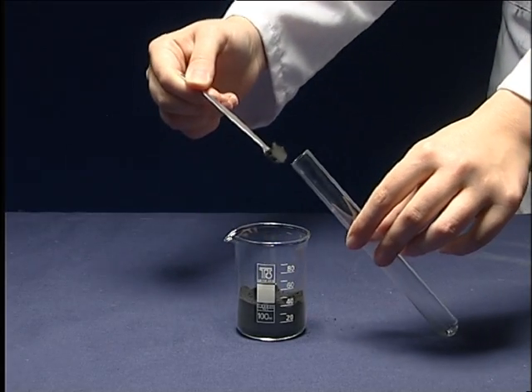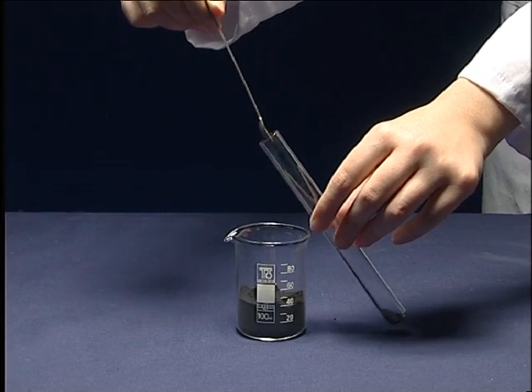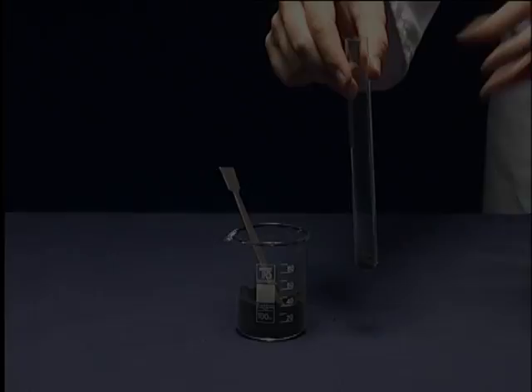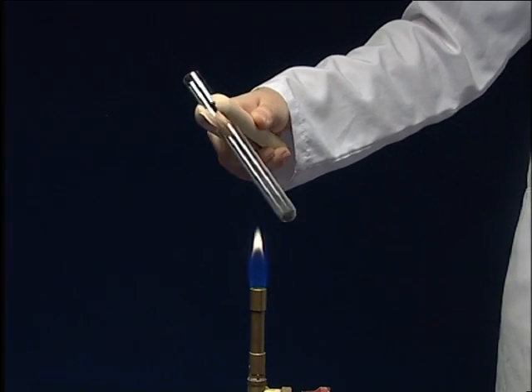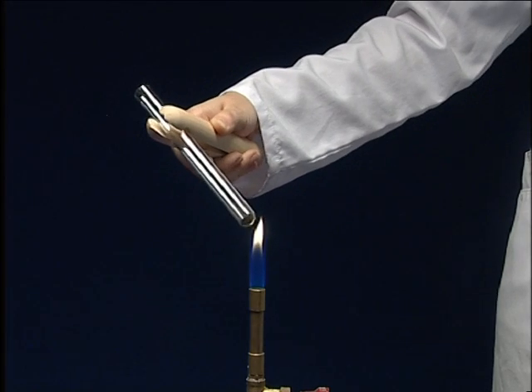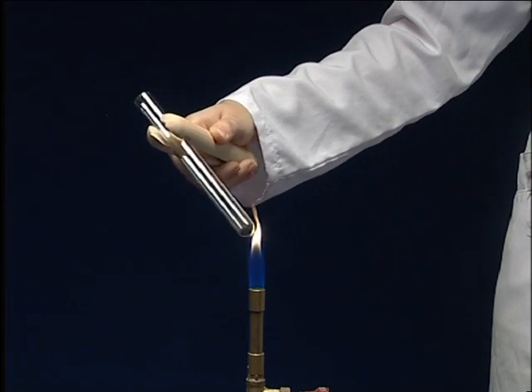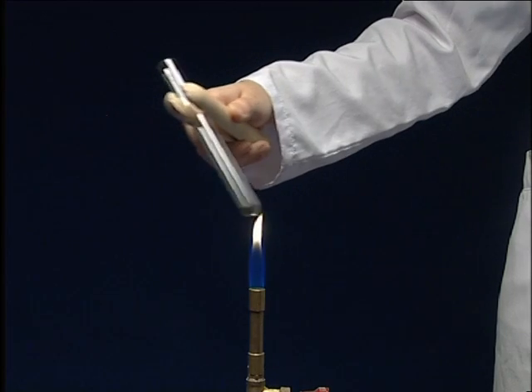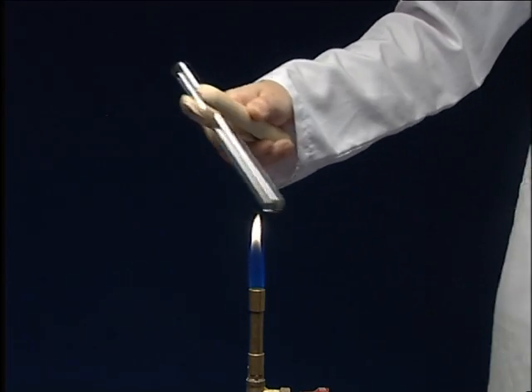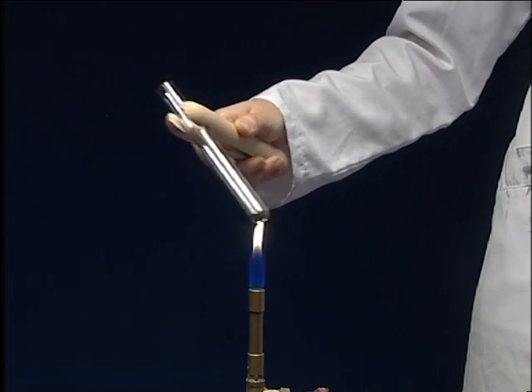In a clean and dry test tube, place about one teaspoonful of Manganese Dioxide. Heat the test tube carefully until all the moisture is taken off; otherwise, the catalyst won't work efficiently. Do not apply the flame continuously to one spot — heat the test tube homogeneously.